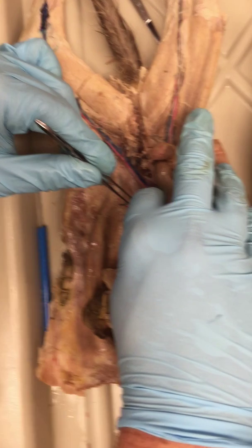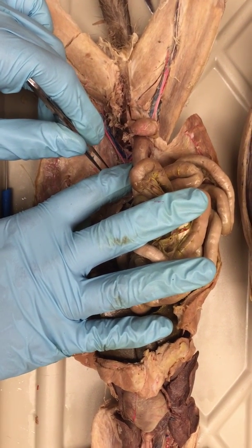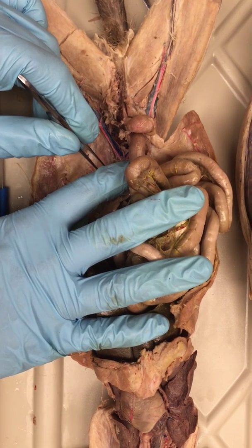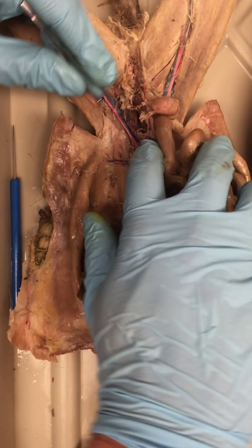Here is the iliolumbar artery and vein, and you must know that there is a correction in the book where there's for some reason 2 adrenal lumbar arteries. Okay, this is the iliolumbar. You should know it. Okay.